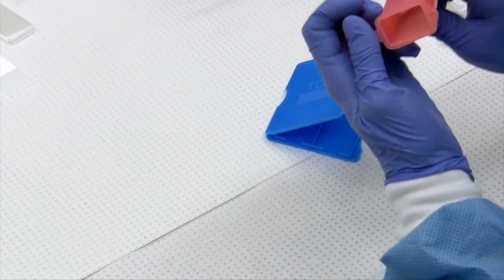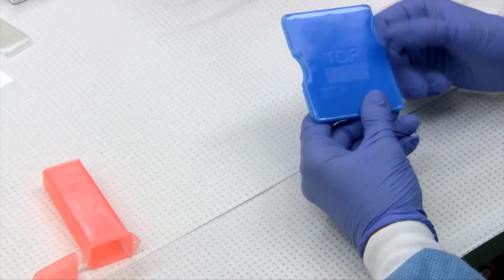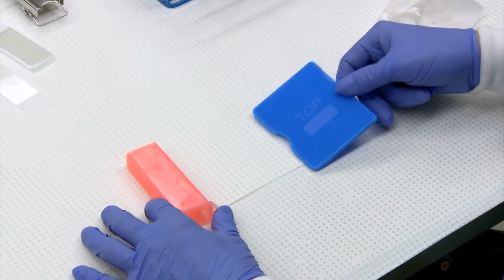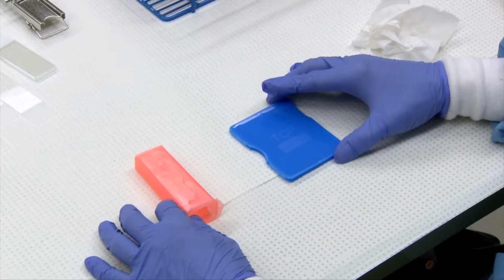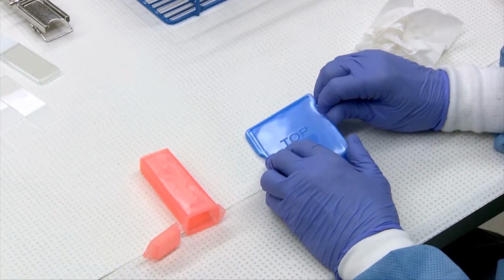This one can hold up to 4 or 5 slides. This one just holds 2. But that said, you still need to wrap them in bubble wrap or something like that just to protect them from breakage. And it's also important to separate any slides from formalin-containing vessels. Otherwise, the cell quality is terrible and you won't get a result on your cytology submission.